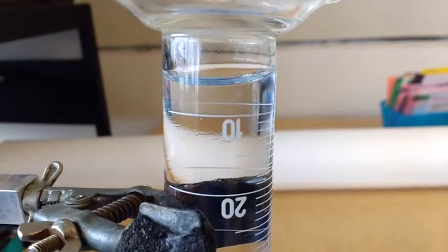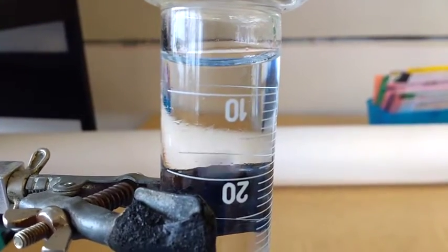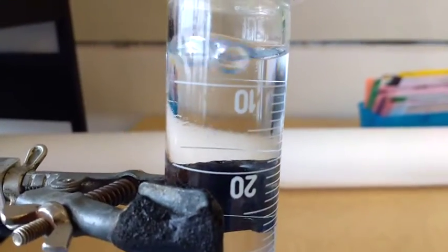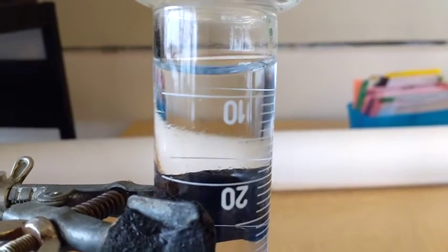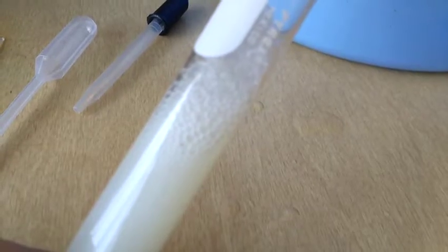Now this lab is only running for like 30 seconds or so, and already I've made multiple milliliters of gas. And so you'll measure how much gas is made over a certain amount of time, and record that in order to communicate how fast this reaction rate is going. You can see that there are bubbles being made in this test tube.